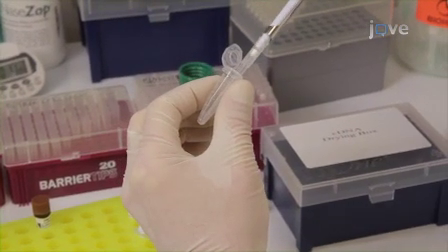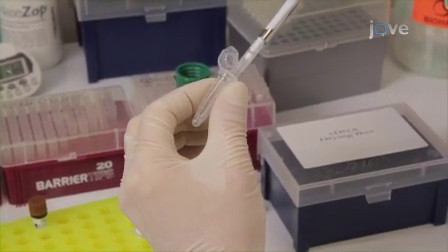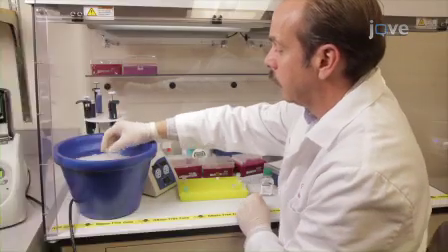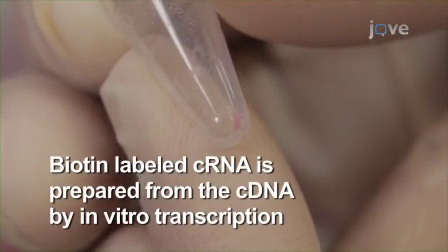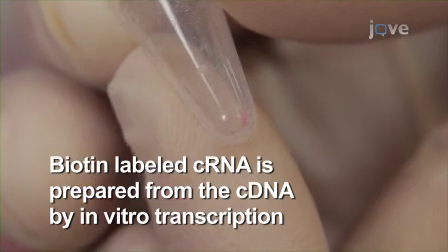Visualize the dried pellet to confirm it is present in the tube. Finally, resuspend the dried pellet in 22 microliters of RNase-free water and place the tube on ice. This cDNA is then used to prepare biotin-labeled cRNA by in vitro transcription using the Enzo BioArray kit.